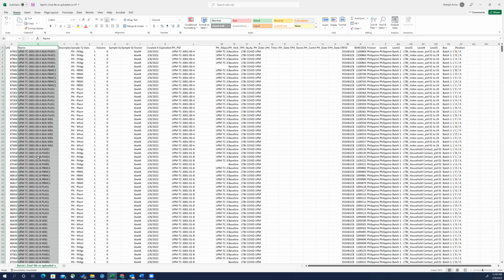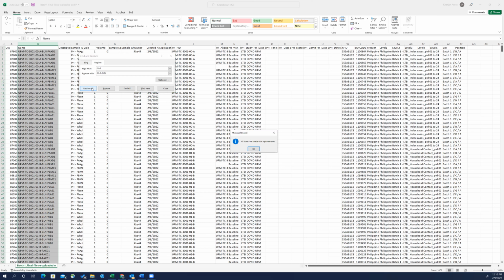So similarly, we're going to have 01 dash B and 02 dash B. That will also be replaced by putting the BLN in the middle. So 01 dash B, and 02 dash B. Replace all, so 624 replacements here, and then there will be 624 replacements of this.